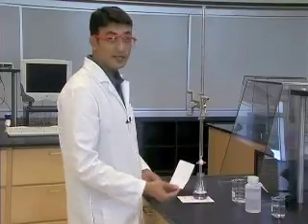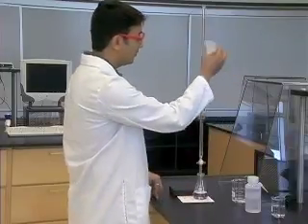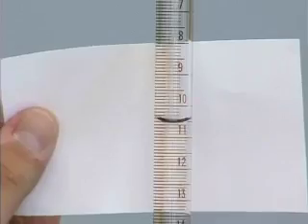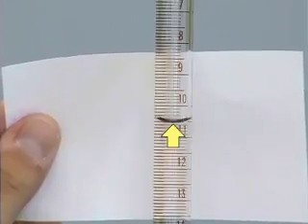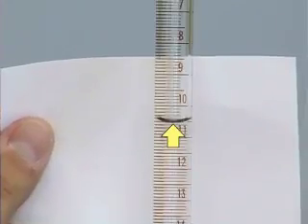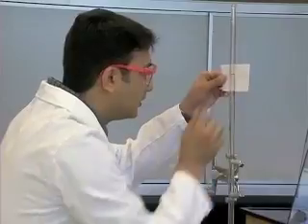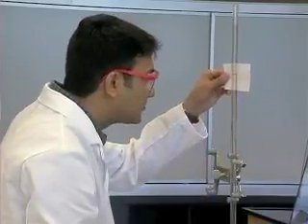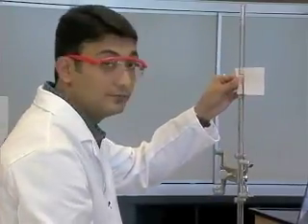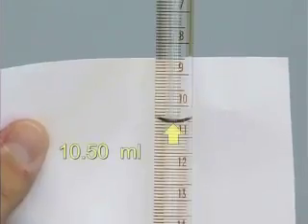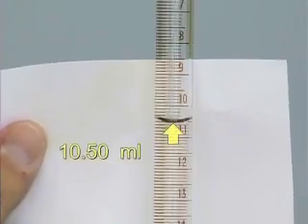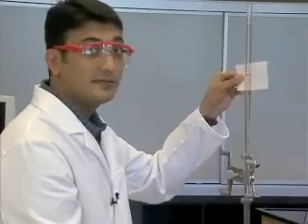I am now going to place a white piece of paper behind the liquid level of the burette. Observe the lower meniscus level of the titrant relative to the volume markings of the burette and record the volume up to two decimal places in your lab manual. In this case our volume is 10.50 milliliters. This is the final volume.